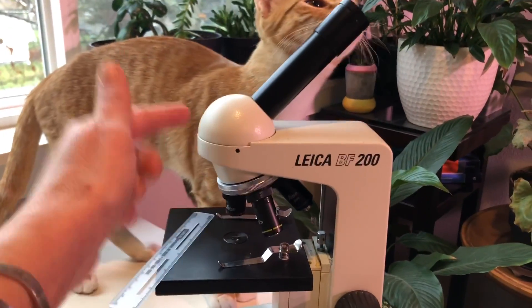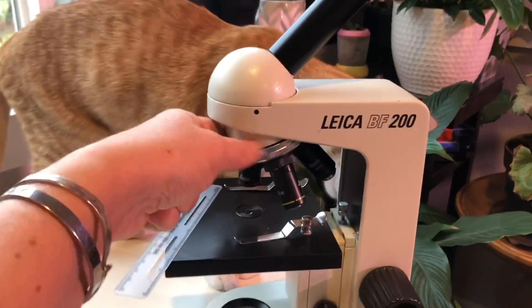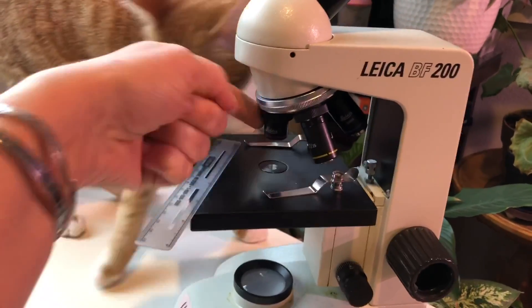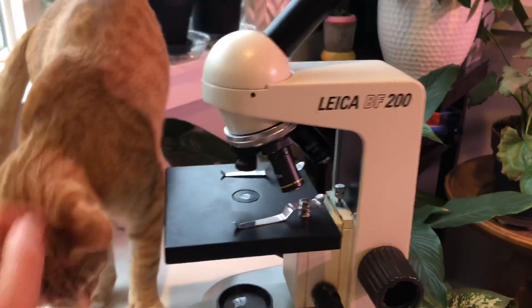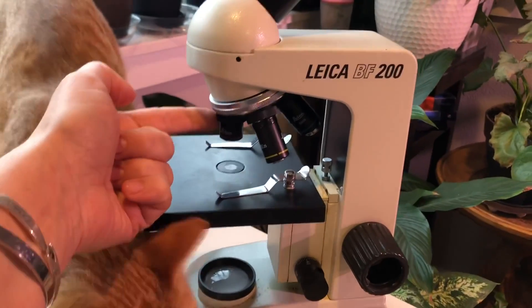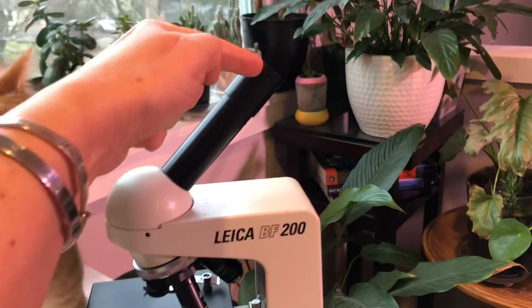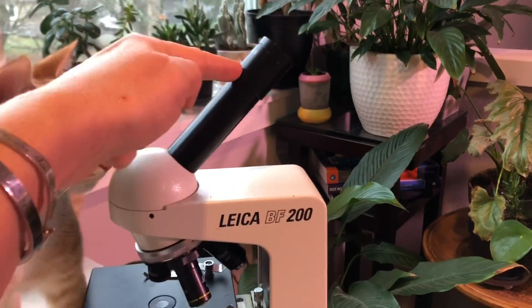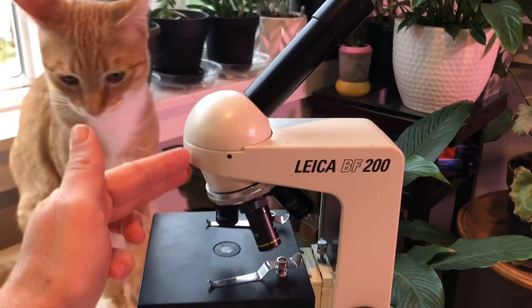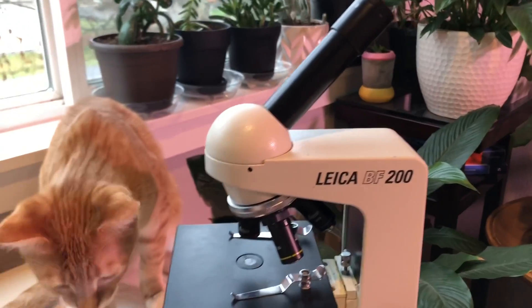Here's our microscope. This microscope is set to have the objective lens to the lowest one. On this microscope, the lowest objective is a 4x. I've got my objective lens at a 4x and my eyepiece at a 10x, so this is going to have a total magnification of 4 times 10, or 40x.